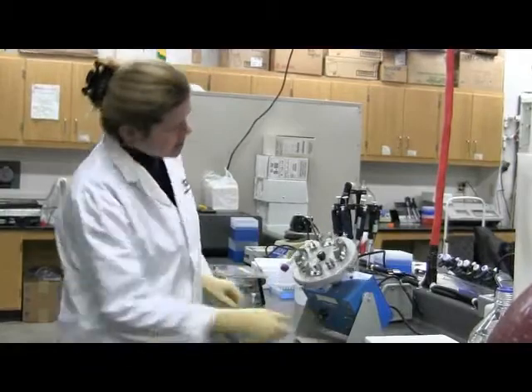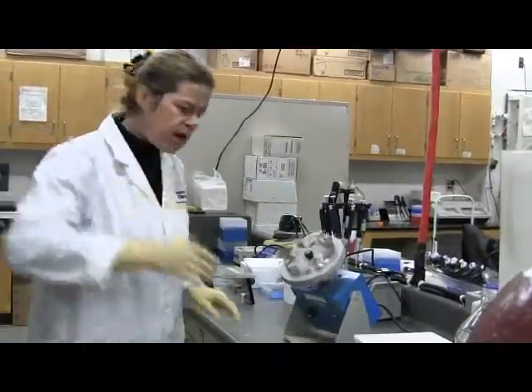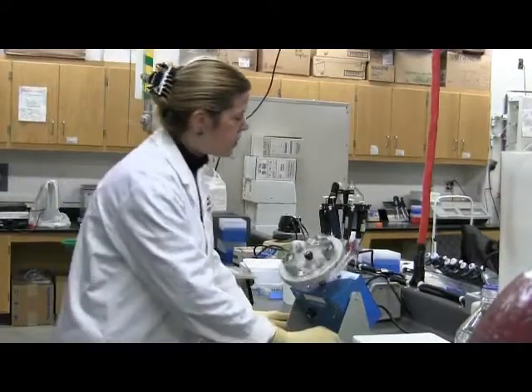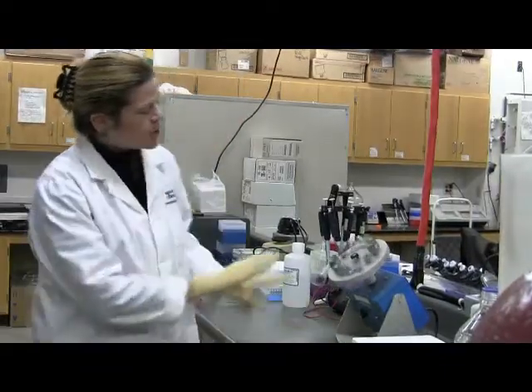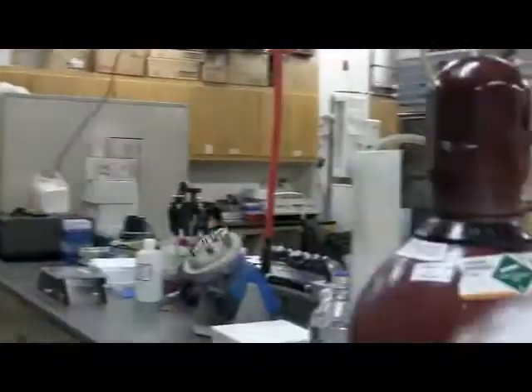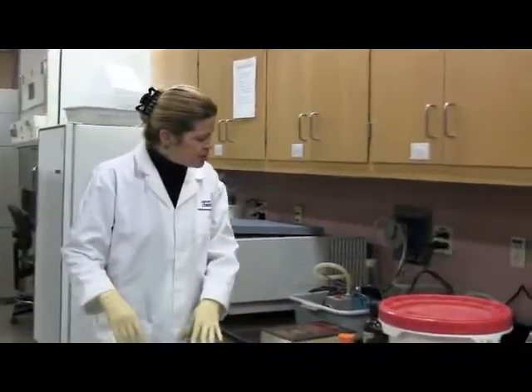And you're going to turn it on. And if you can see, this does end-over-end mixing. Okay, so this will be the first thing you do. You're going to put it there, and it won't degrade in the dimethyl sulfoxide. So you're going to just let this turn for a while, and then you're going to come back over here, and we're going to continue making solutions. Right. So that's the substrate solution.